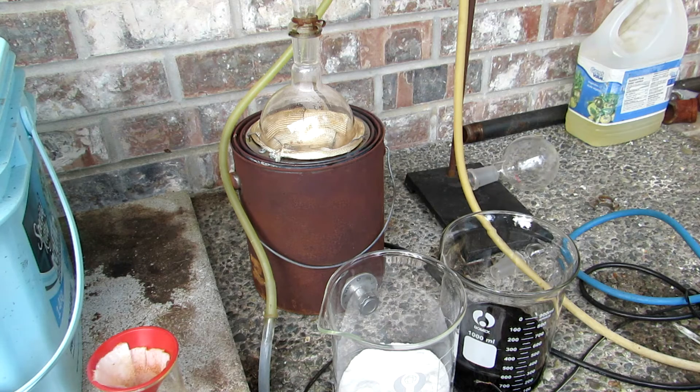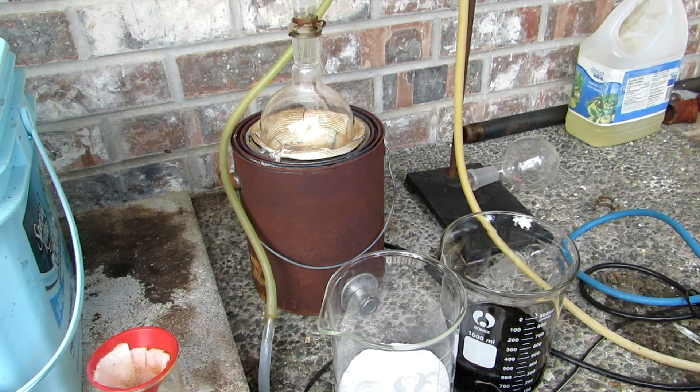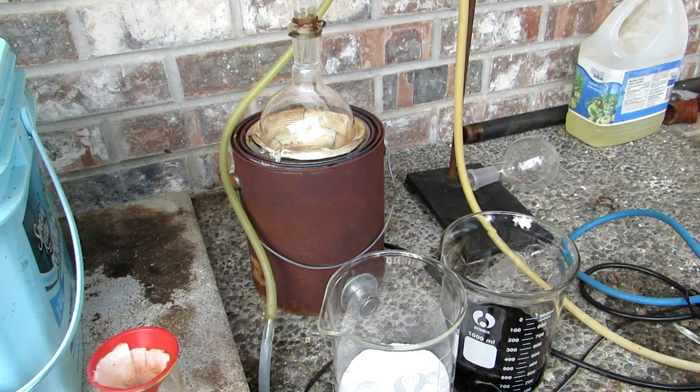Now, this reaction proceeds in a 1 to 1 molar ratio, so if you're using some other concentration of sulfuric acid, you could adjust the amounts accordingly.